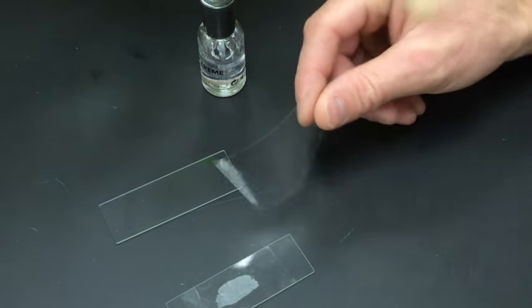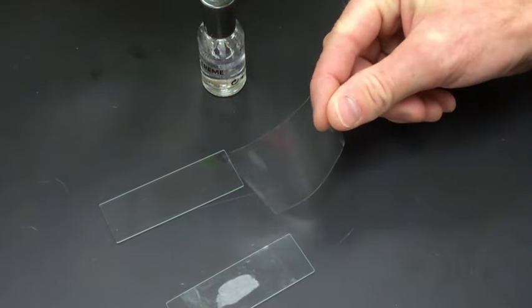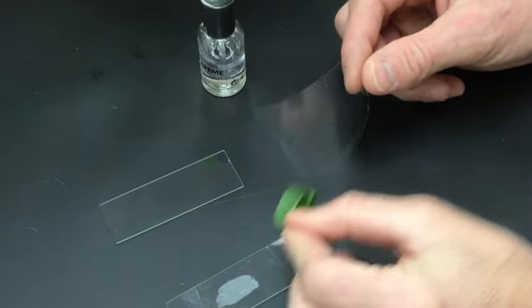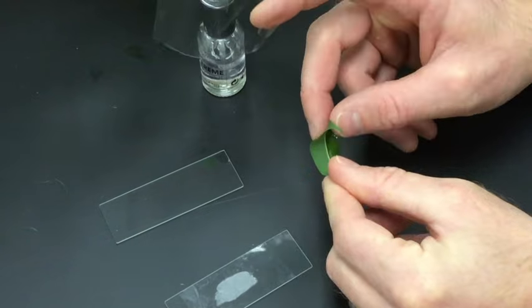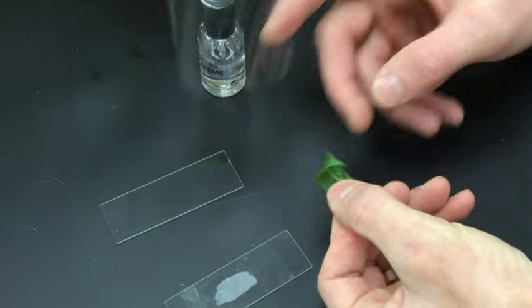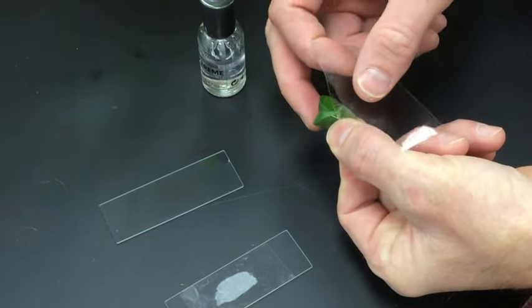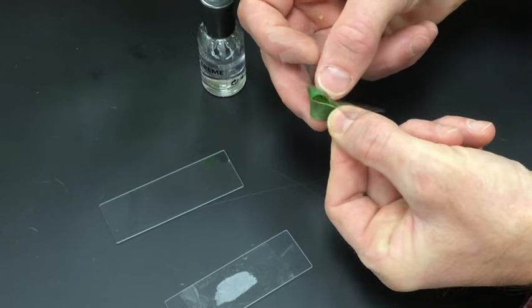Another piece of clear tape. The other plant leaf. This one's going to be kind of harder. It's kind of got a curve to it. Again, try not to touch the nail polish and get your fingerprints on it. It can be kind of difficult not to do that.